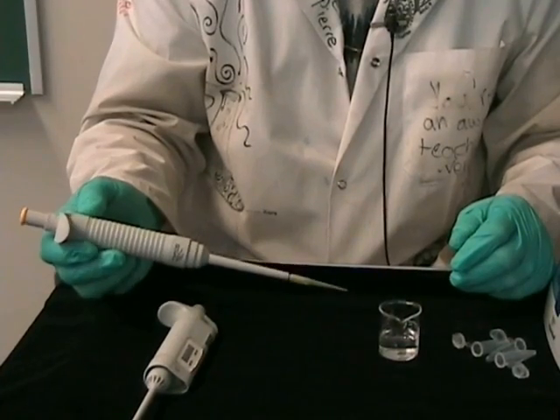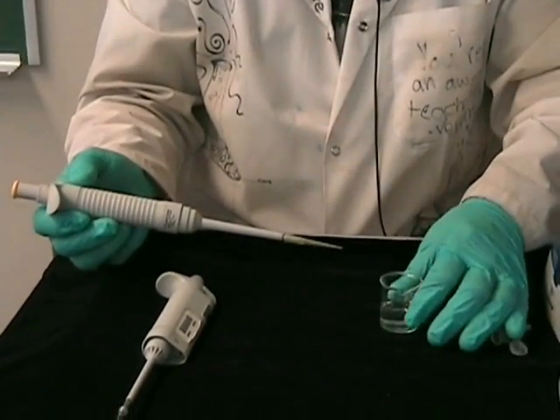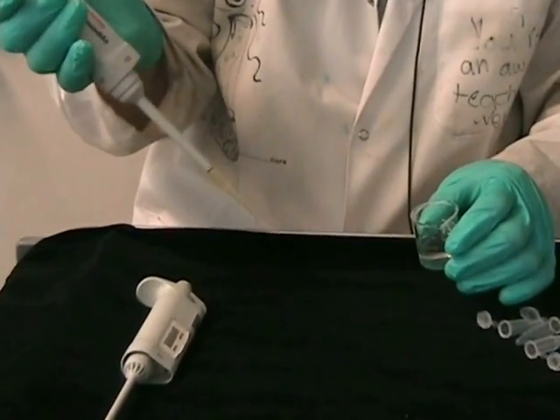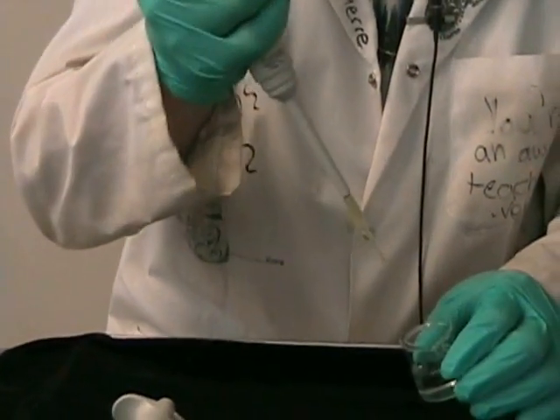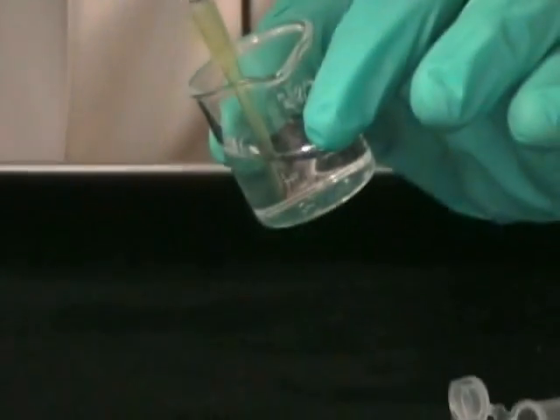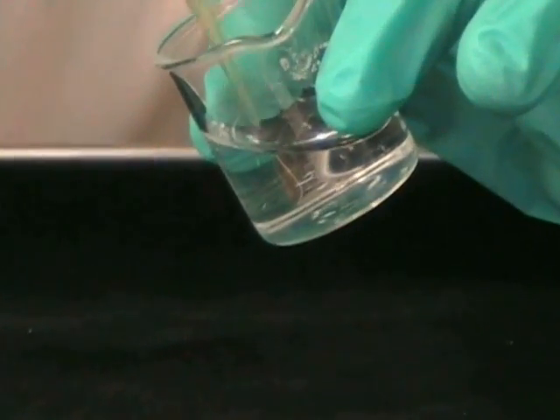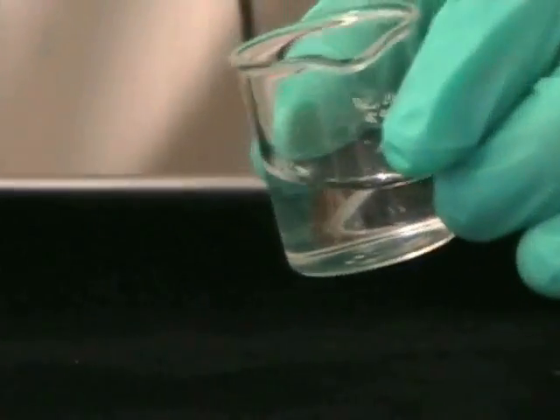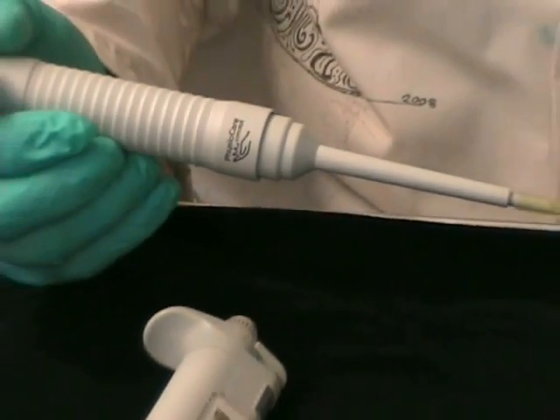Now we're going to look at some common mistakes. One of the most common things that I see is people creating bubbles in their solution. When you immerse your tip, people compress the air out, creating bubbles. If this was a protein solution, you'd be creating a lot of foam, and foam means denaturation.